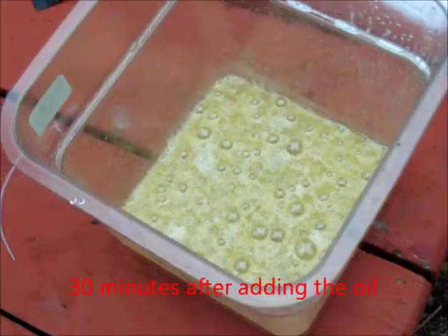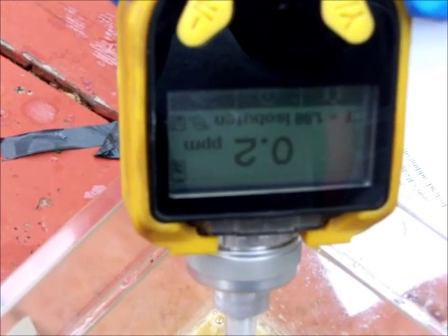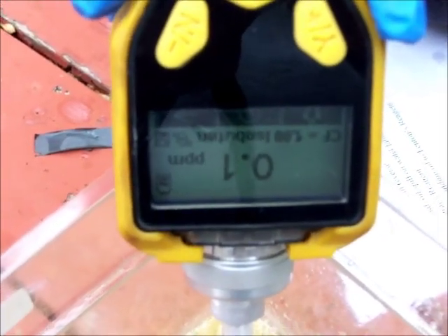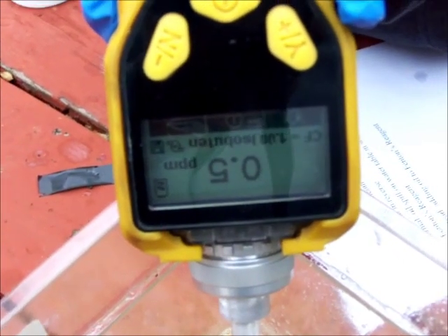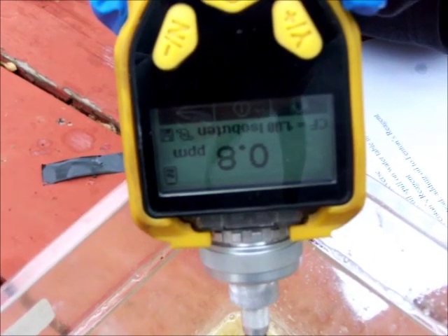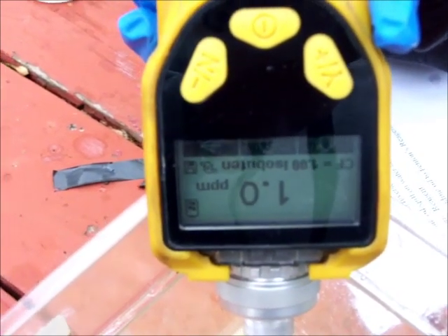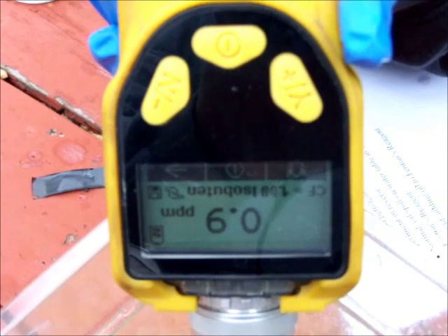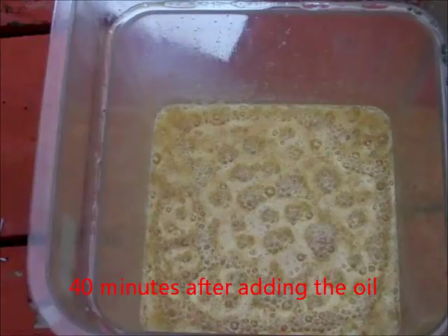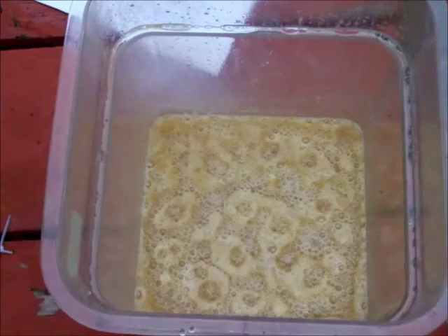It's bubbling more vigorously now and we're going to check the PID again. 0.7, and it's increasing. As you can see, it's getting much higher than it was before. The reaction is occurring more rapidly now. It's starting to smoke slightly.